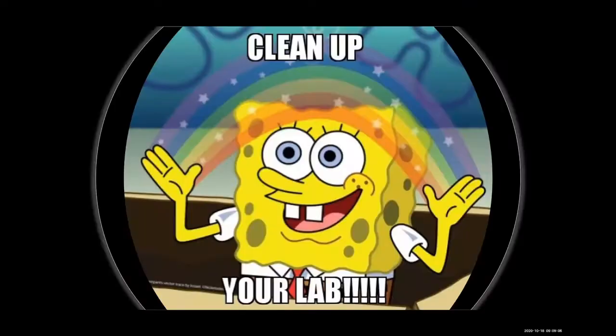What did you observe? Bright blue. The water turned blue or the crystals? The water and the crystals. Okay, good deal. Clean up your lab.